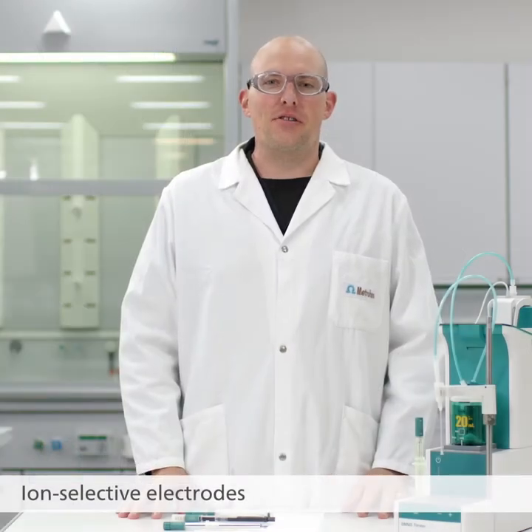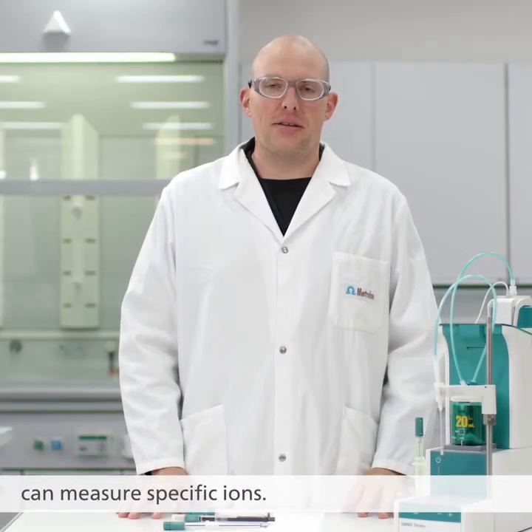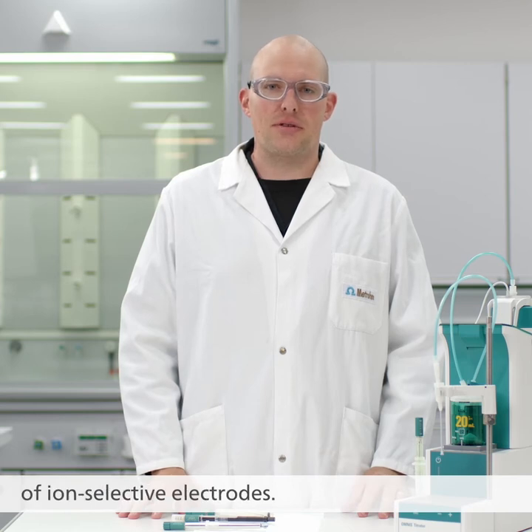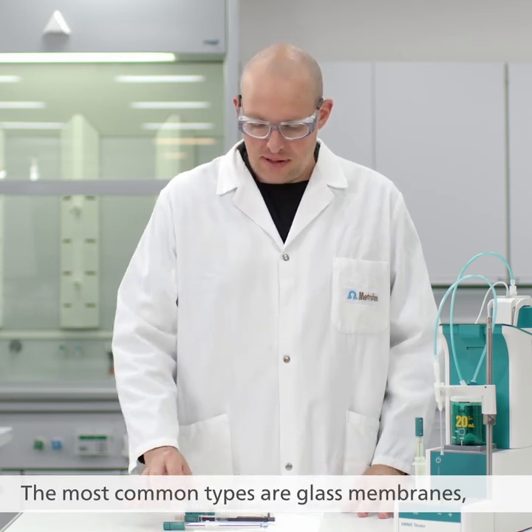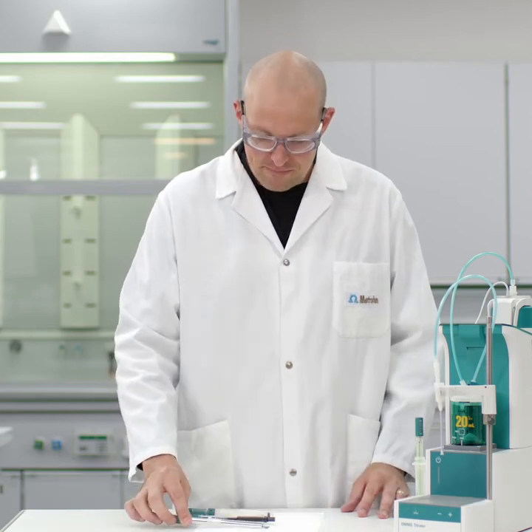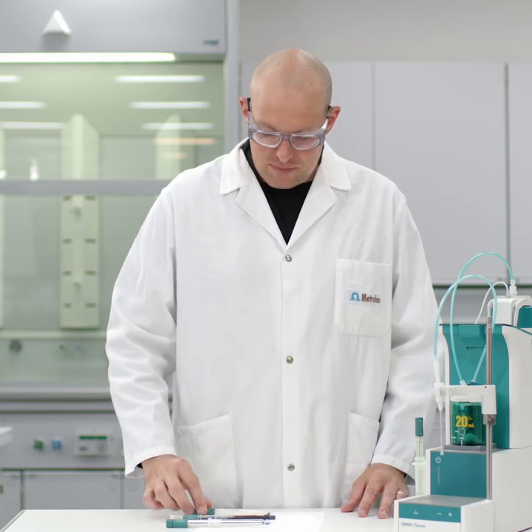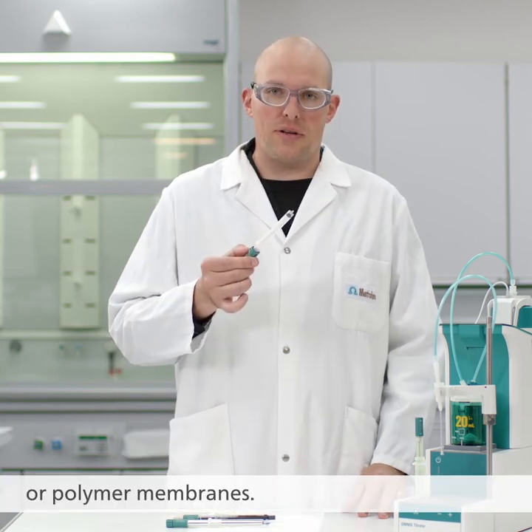Ion-selective electrodes can measure specific ions. There are different types of ion-selective electrodes. The most common types are glass membranes, crystal membranes, or polymer membranes.